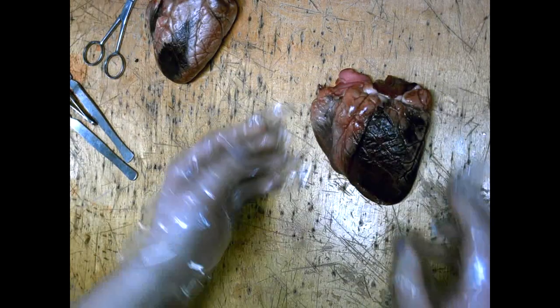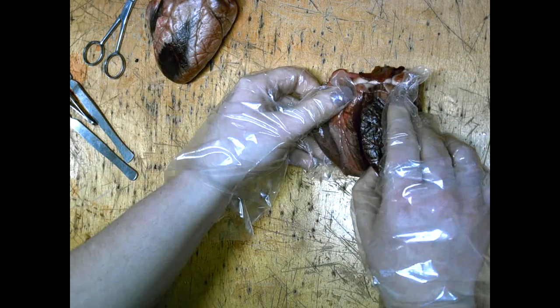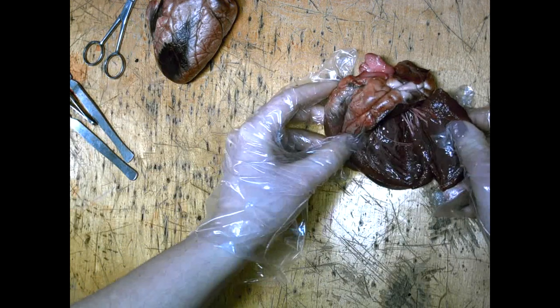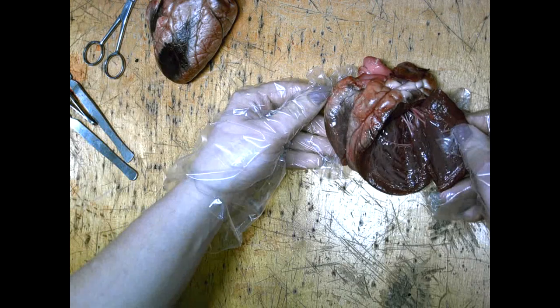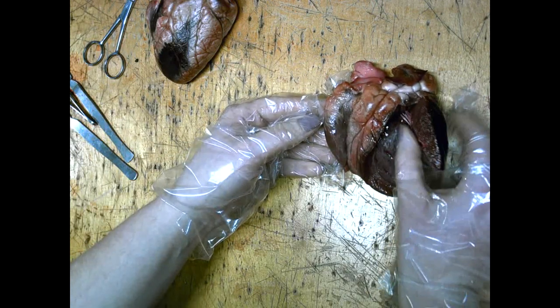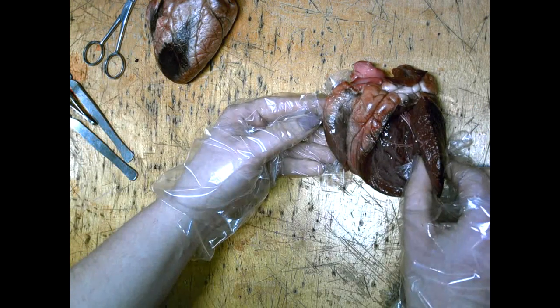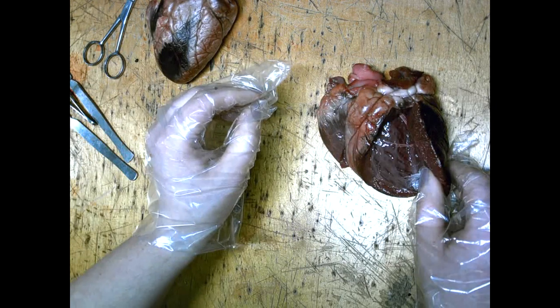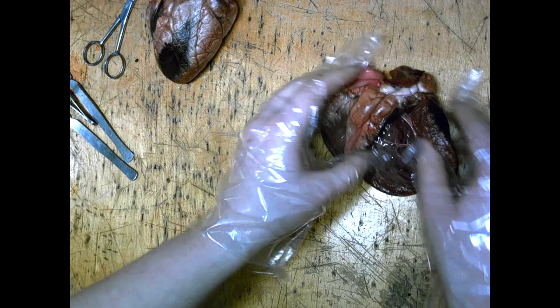When the heart is dissected, you can firstly open the left side of the heart. The left side of the heart receives blood from the lungs and then pumps it around the body. It can clearly be seen the thickness of the muscular wall. This thickness is because the heart has to pump the blood around the body from here, so it is leaving the heart under high pressure.